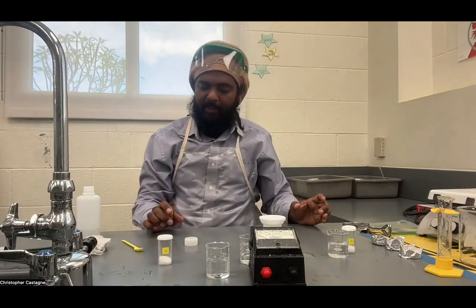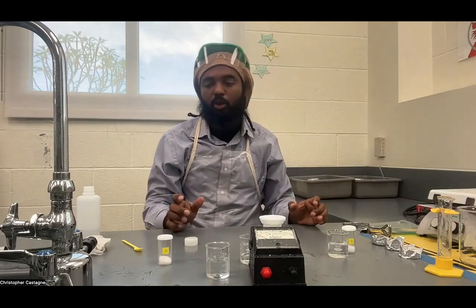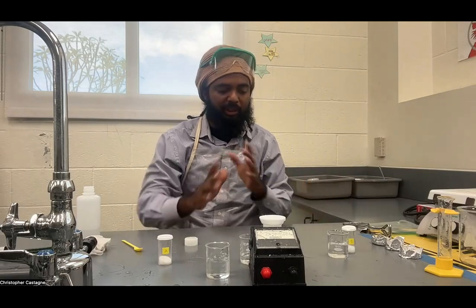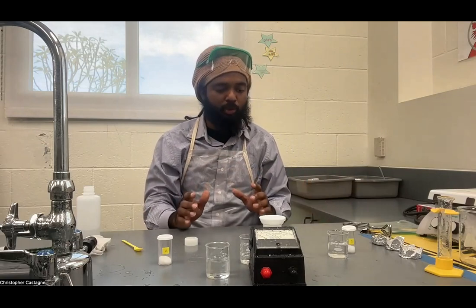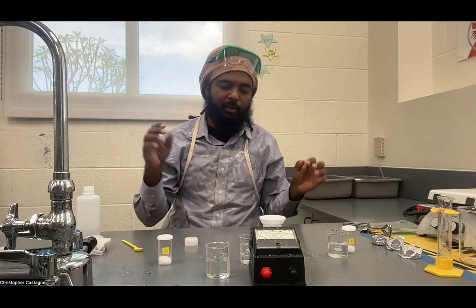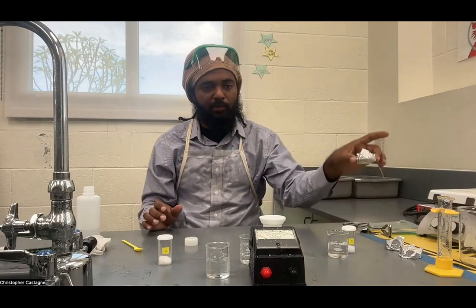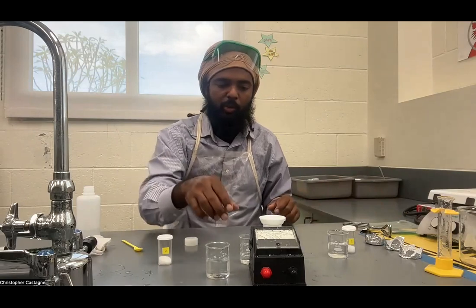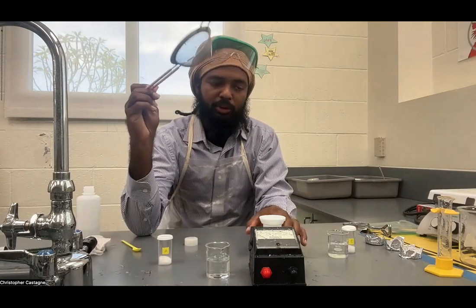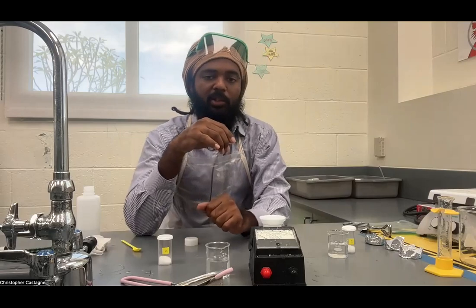Then we clean up. One thing to keep in mind is that one of the substances I use is sometimes Epsom salts, which is a laxative. So definitely make sure you clean your hands with soap, and do not eat in the chemistry lab. Wash your hands before you go have lunch or anything like that. Discard the foil and all solids in the bin. Drain any undissolved solid with the strainer and throw solids in the bin, liquids down the sink. And we're done with this part of the lab.